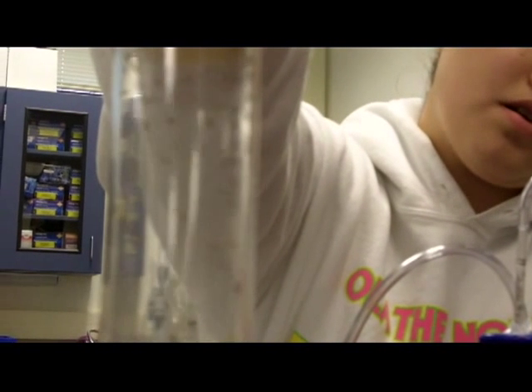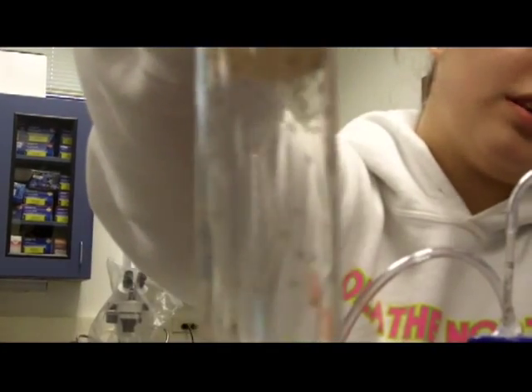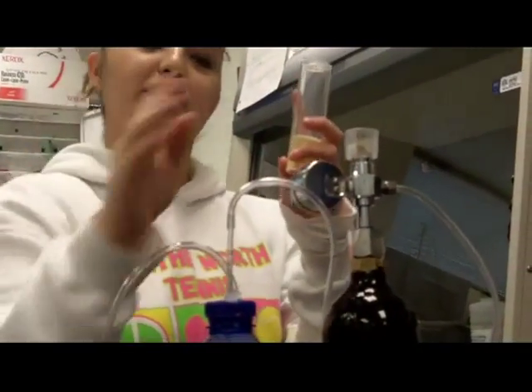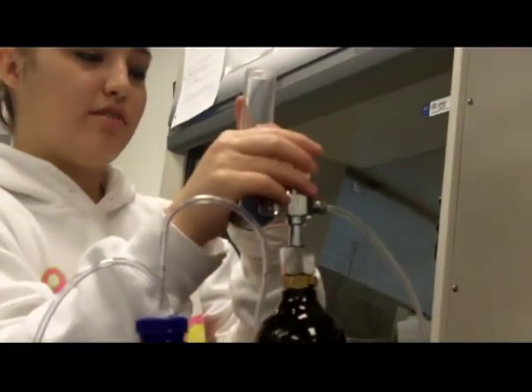What you're going to do is interact with one another. I'm going to anesthetize this again, but this will be easier to see, and it'll show you the accurate way to anesthetize them.